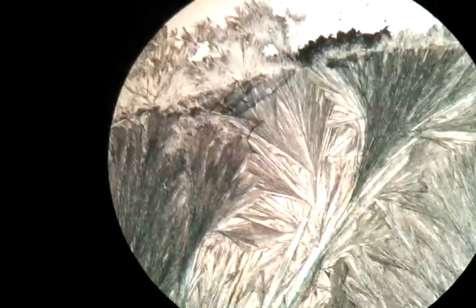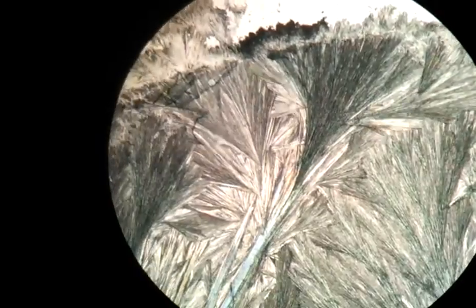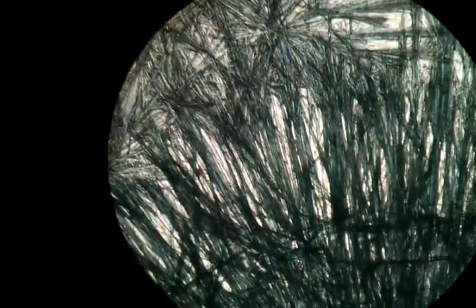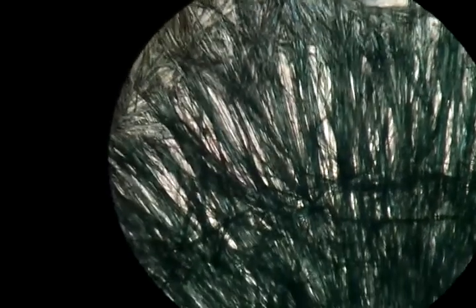You can try to follow these into the edge — very strong. Here the color stopped as well. This very long needle goes all the way in here. And here's another part of supersaturation.